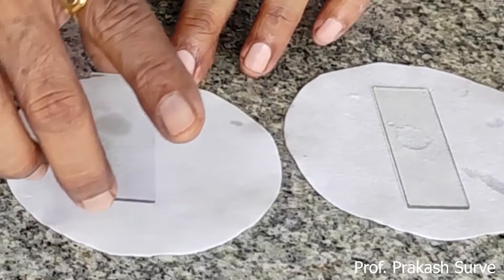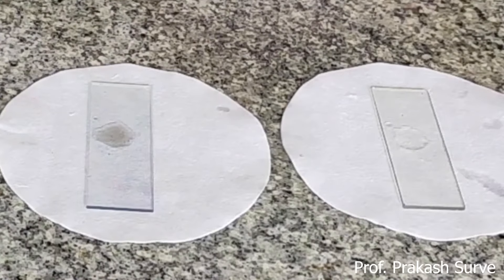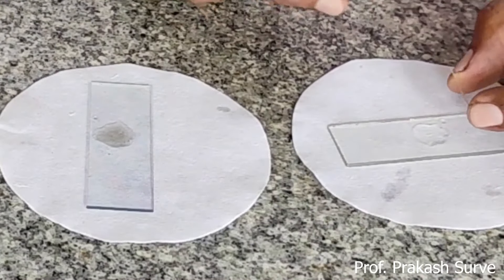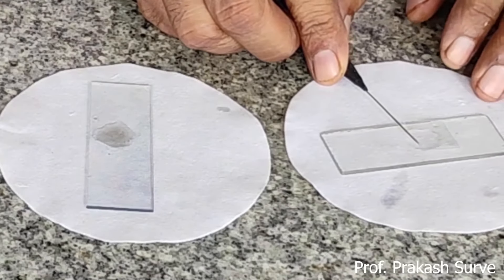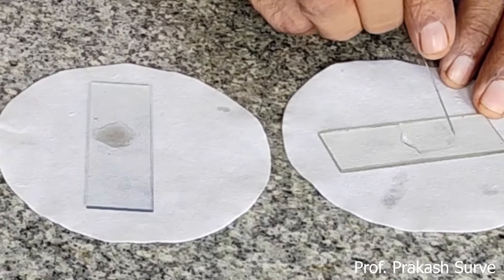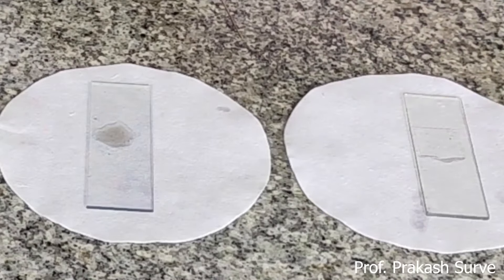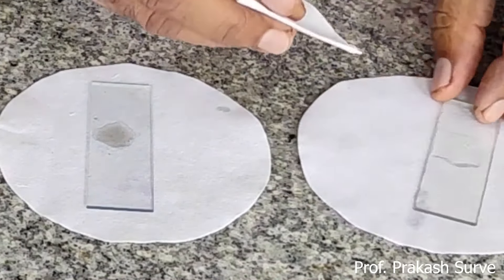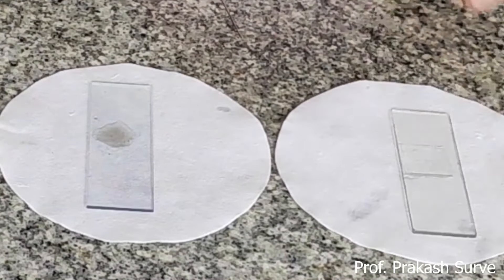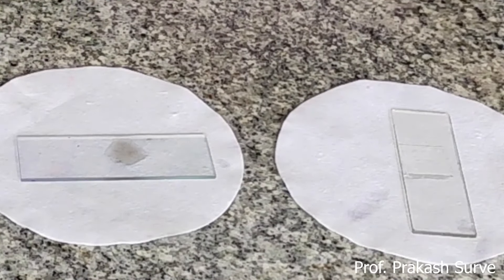Before placing under the microscope, we put a cover slip on each slide. Watch this video to the end — you will find the answers to the questions in your practical book. For the washed leaf slide, place the needle below the cover slip and slowly release it so there are no air bubbles. Keep the cover slip centered and remove any excess glycerin with filter paper so the slide is neat and clean.